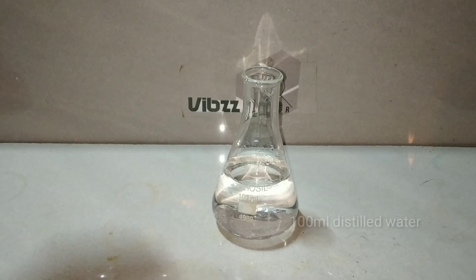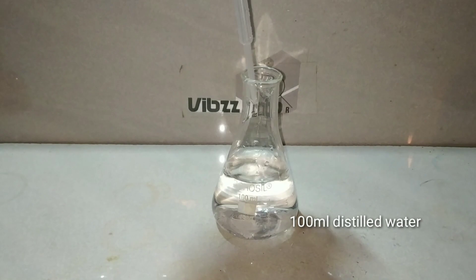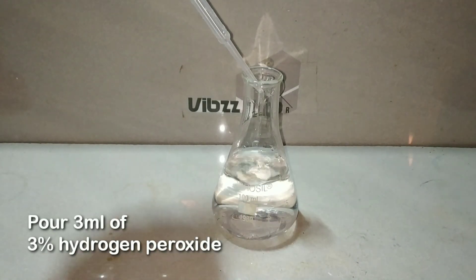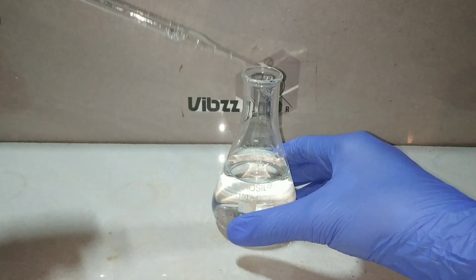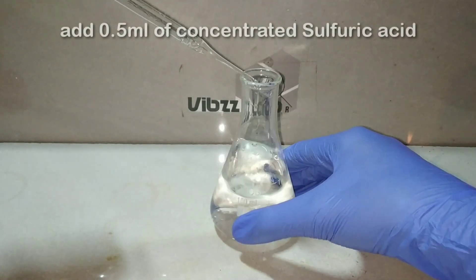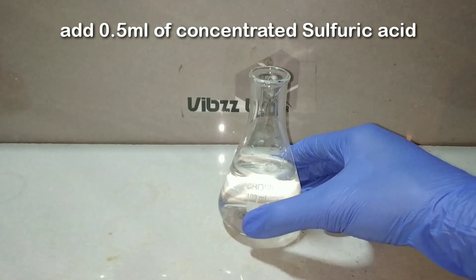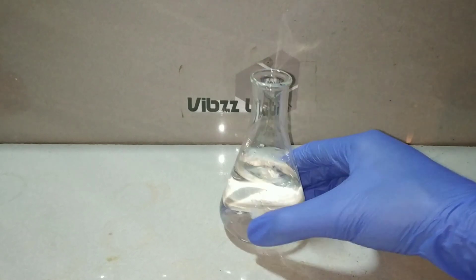Now we will be preparing the peroxide solution. I have taken 100 ml of distilled water in an Erlenmeyer flask, added 3 ml of 3% hydrogen peroxide, and now I am adding 0.5 ml of concentrated sulfuric acid with constant stirring, as we should always be careful while adding concentrated acid to water.